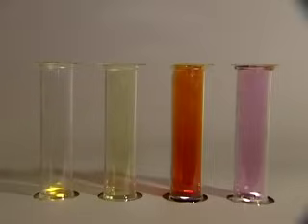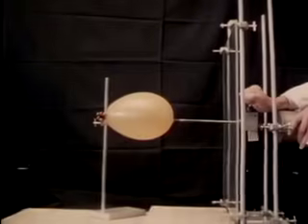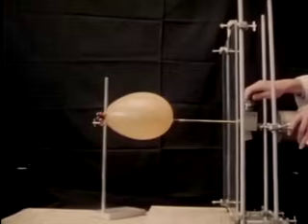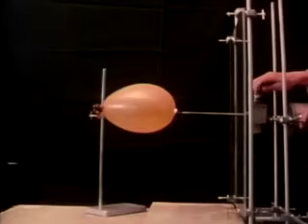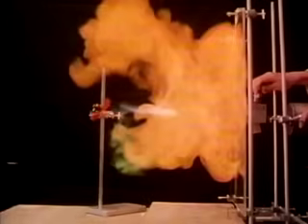Fluorine reacts — often ferociously — with almost everything else. A stream of fluorine instantly sets iron wool on fire, and it does the same thing to charcoal. Now let's see the reaction with hydrogen. There's hydrogen in the balloon. A jet of fluorine gas pierces the balloon and explodes with the hydrogen inside. Let's see it again in slow motion — now you can see the fireball more clearly.